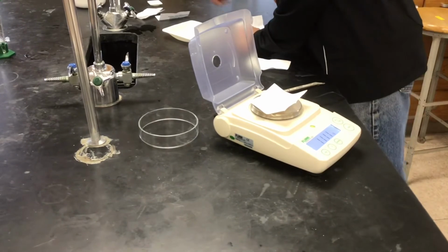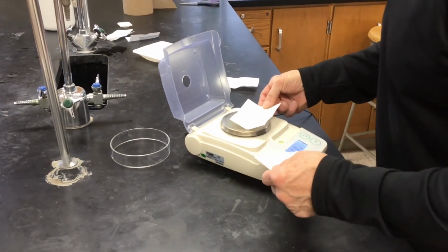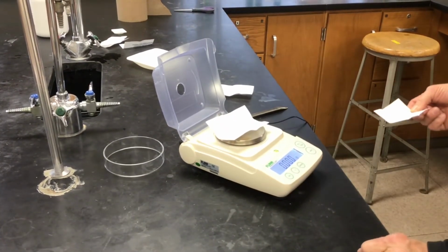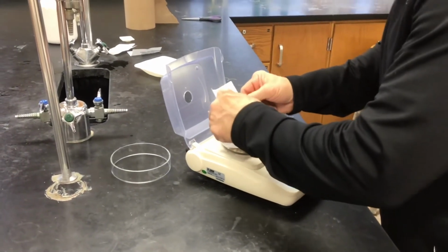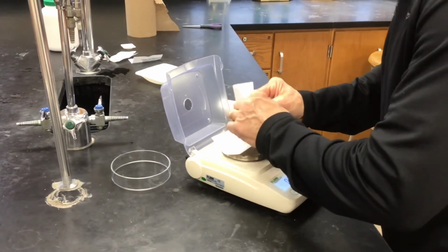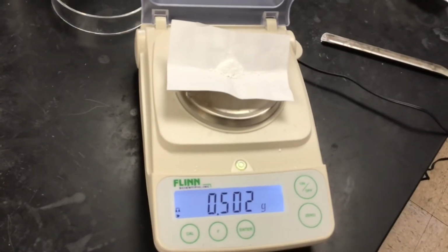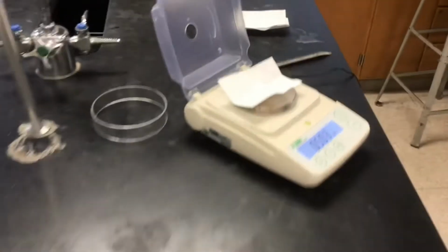Hold on. I swear it was 0. All right, let's try again. Definitely reading 0 now. Okay. Mass of MgO. Okay.